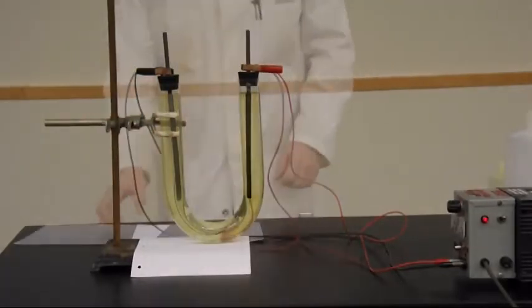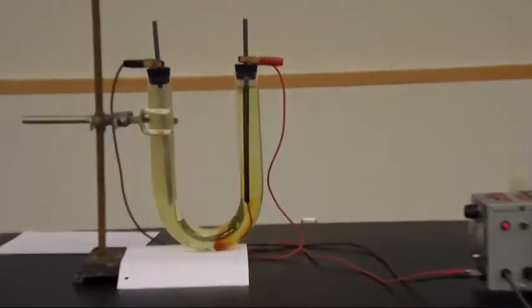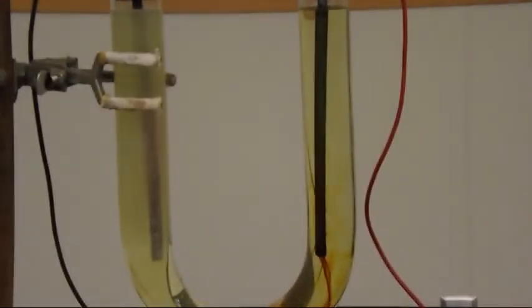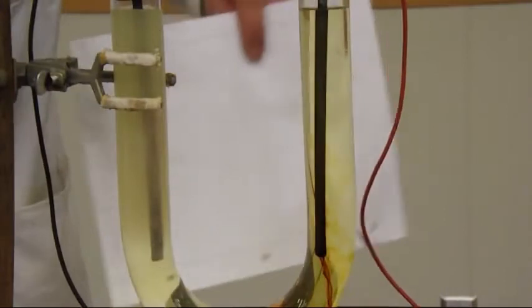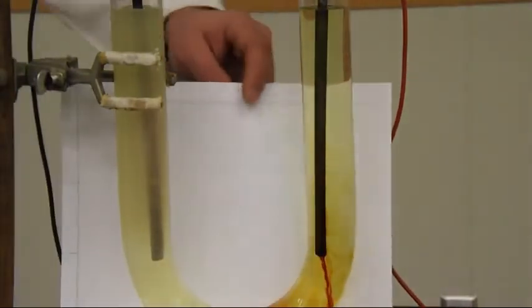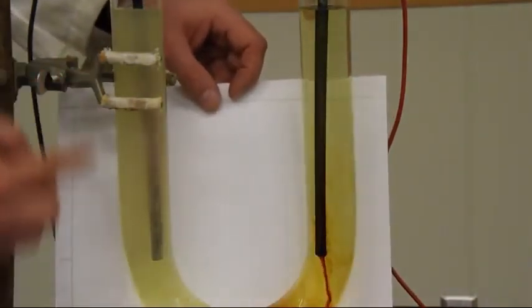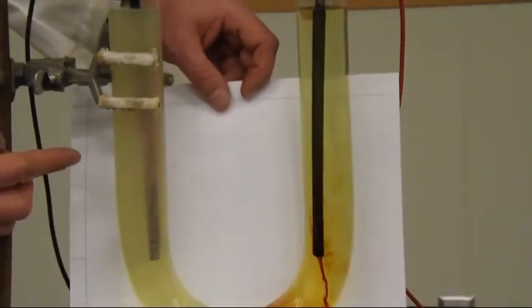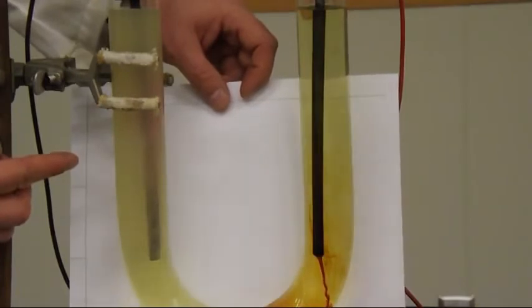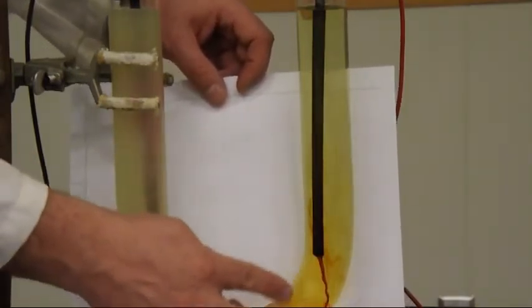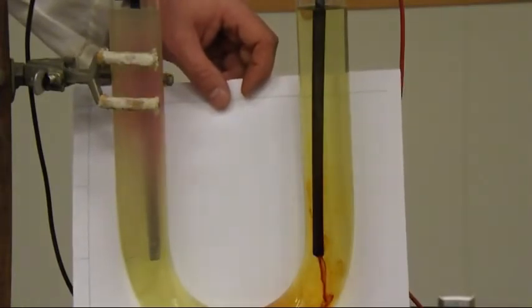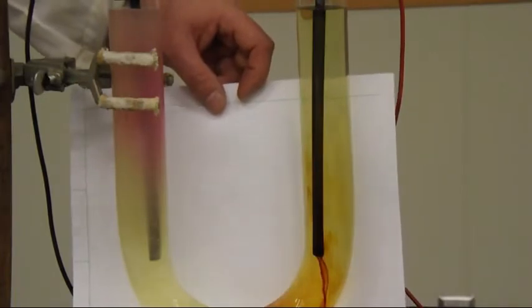And what you should see happening on it from here. And what you can see happening off of one of the electrodes. It's a little foggy in the video, but in reality what's happening is that there's a lot of bubbles being formed. So there's gas being produced there. On the other one you can see down here that there's this sludge that's actually drawing off the bottom of the electrode. And that sludge is brown in color.